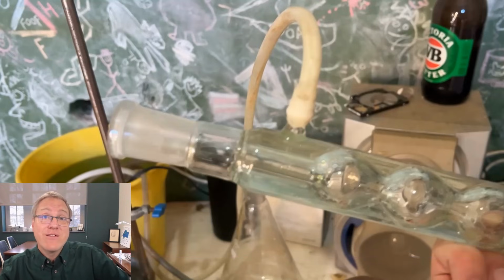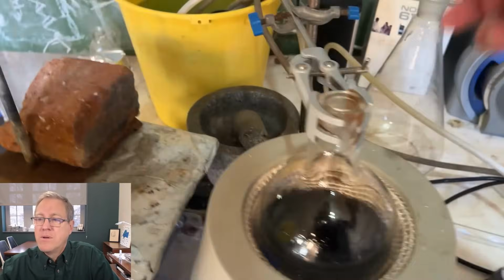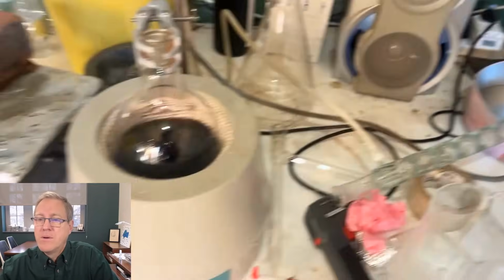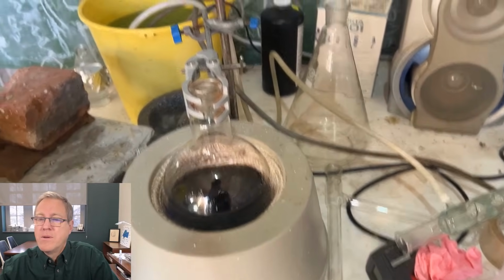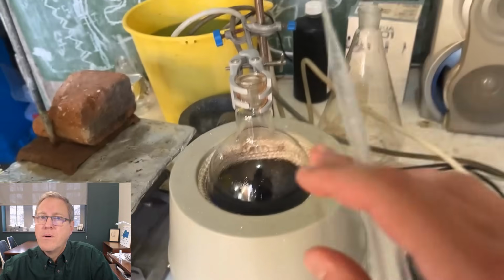he's identified a leak in his glassware. And that happens around these joints. This glassware doesn't last forever. Anyway, I don't think it's ruined anything. Hopefully, maybe those drips of water near the end of the reaction when we're neutralizing it help neutralize it anyway. Should be all right. As long as it's neutral and there's a little bit of water, I don't think it'll break down the thing we've made.